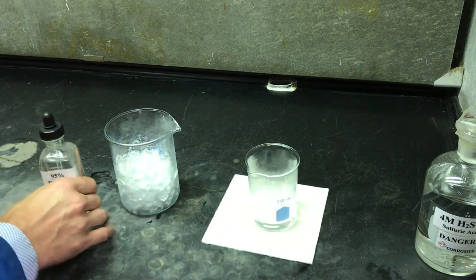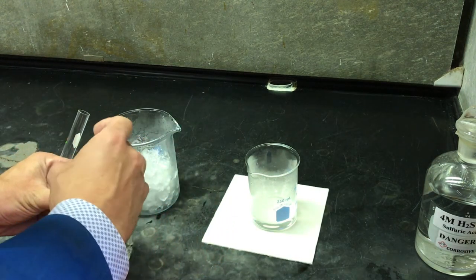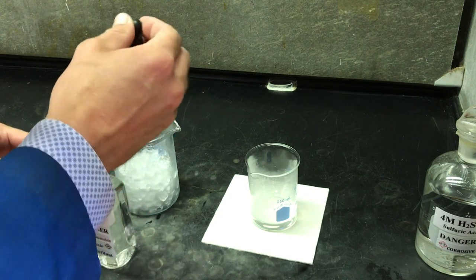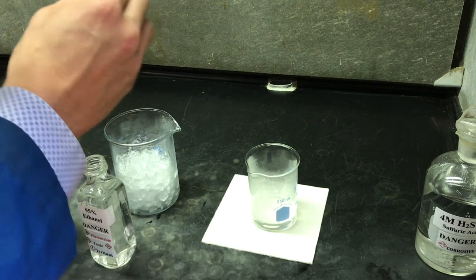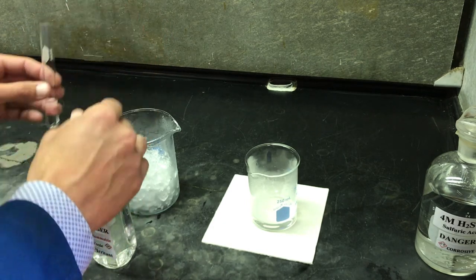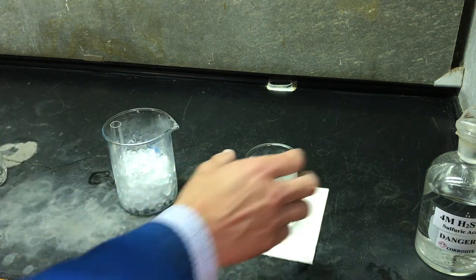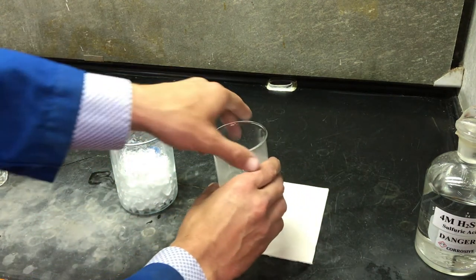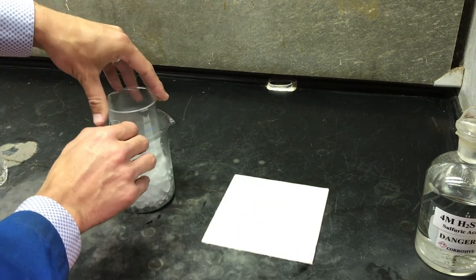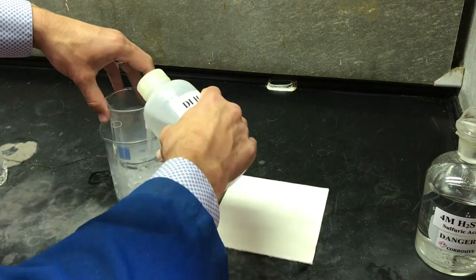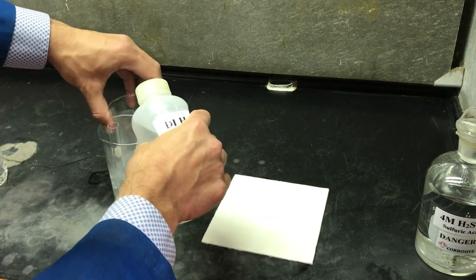We will collect a measure of 95% ethanol and cool it in ice. Additionally, we will place our reaction beaker in the ice and add water to ensure contiguous thermal transfer, otherwise known as an ice bath.